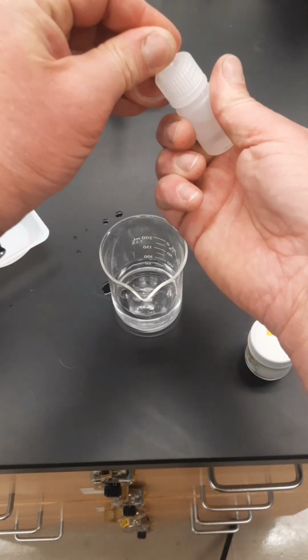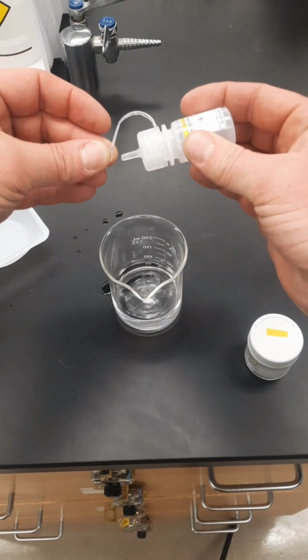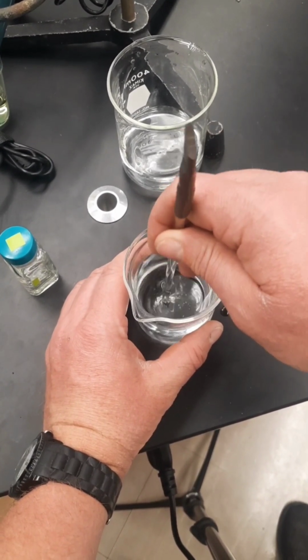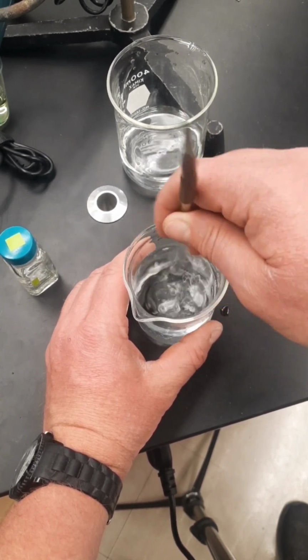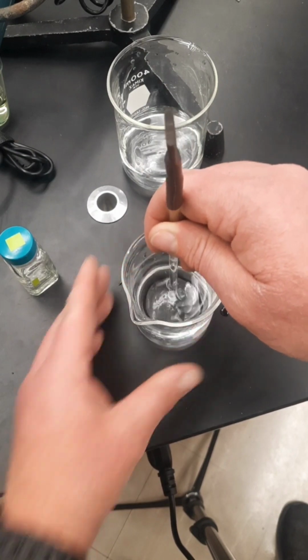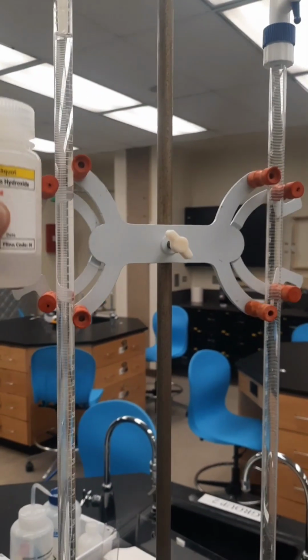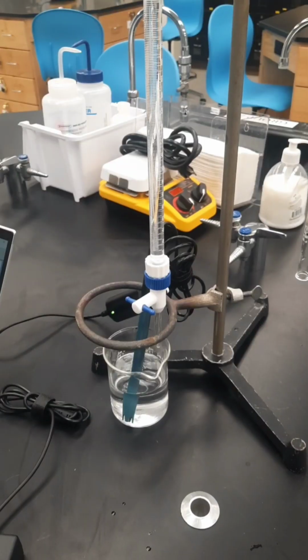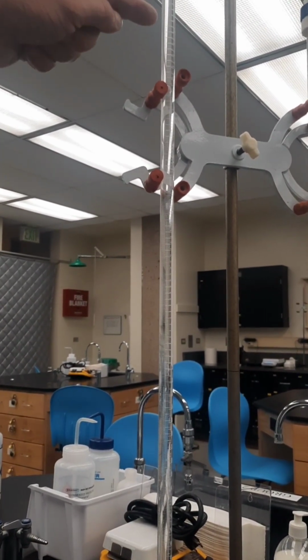And while I'm crushing them up, I'm also going to add about 3 to 5 drops of the indicator phenolphthalein. Making sure that the acid is all dissolved and that I don't see any more grains inside of the solution. As for the burette, we fill it up with the 0.1 molar sodium hydroxide all the way to the tippy top, 0.00 milliliters. For the setup to be complete, make sure that you have base of known concentration and identity filled all the way up to the tippy top of the burette.